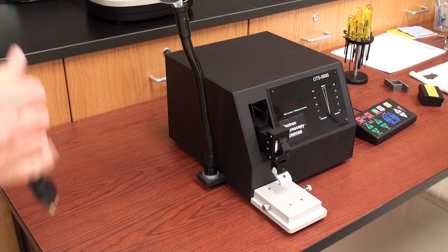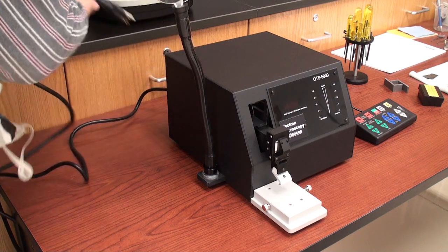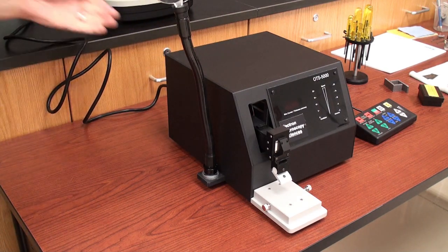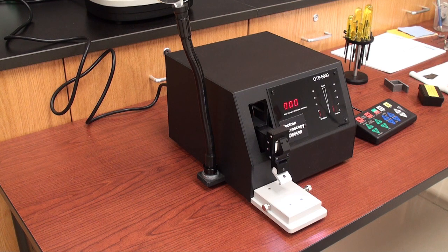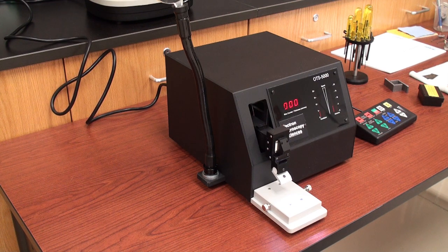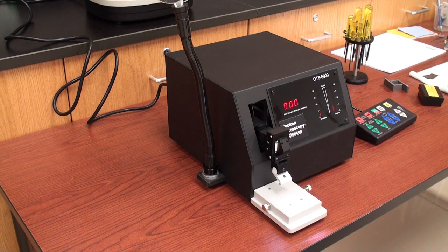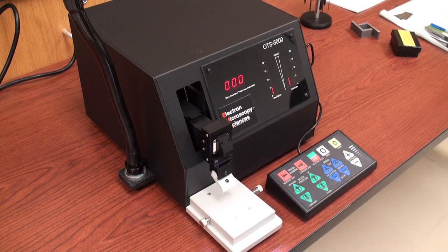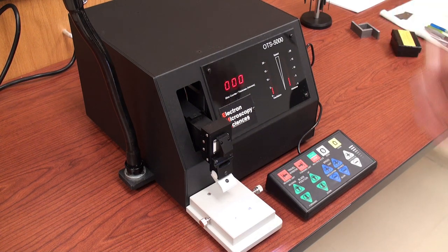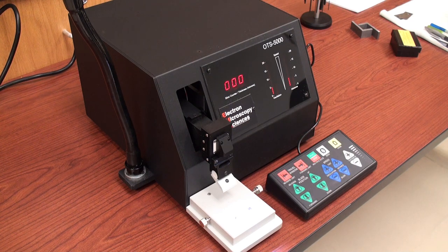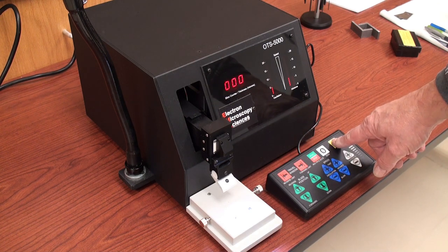The next thing I'm going to do is plug the power cord into the rear of the machine and plug it into the wall and turn the unit on. As you can see a LED light is present to allow you to observe what's happening in the sectioning tray as you're cutting. The next thing we'll do is position the control panel in a convenient spot. It has a fairly long cord so you can sit there with everything in your lap and the first thing that we do is we press home.